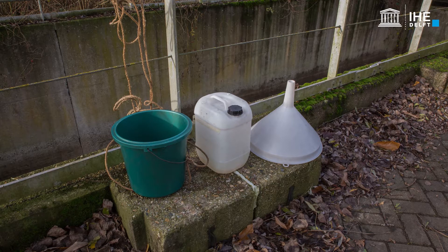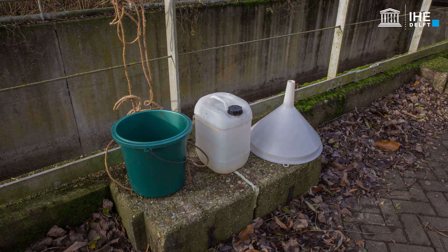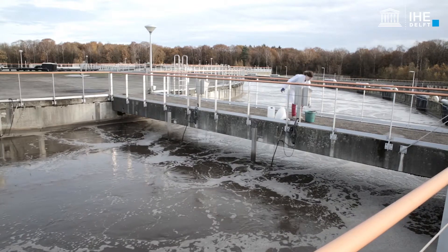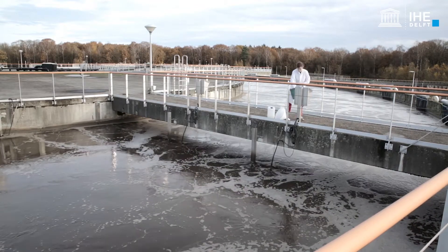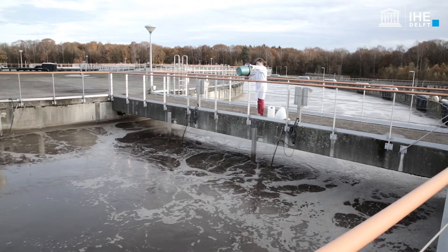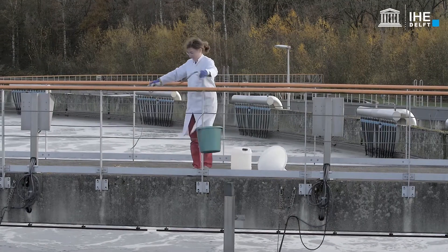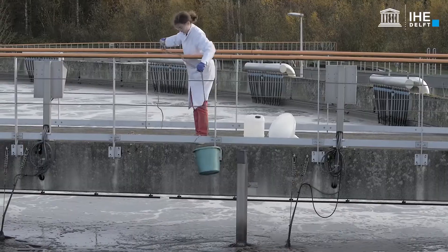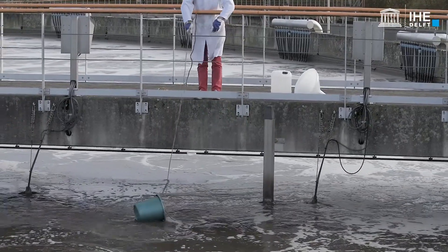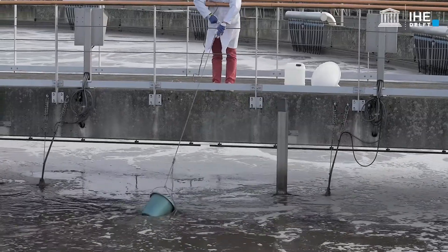The different settling tests require sludge samples from different locations at the treatment plant: the primary influent, the activated sludge tank, the return sludge line, or the secondary effluent. Grab samples can be obtained with a simple sampling device such as a bucket attached to a rope.